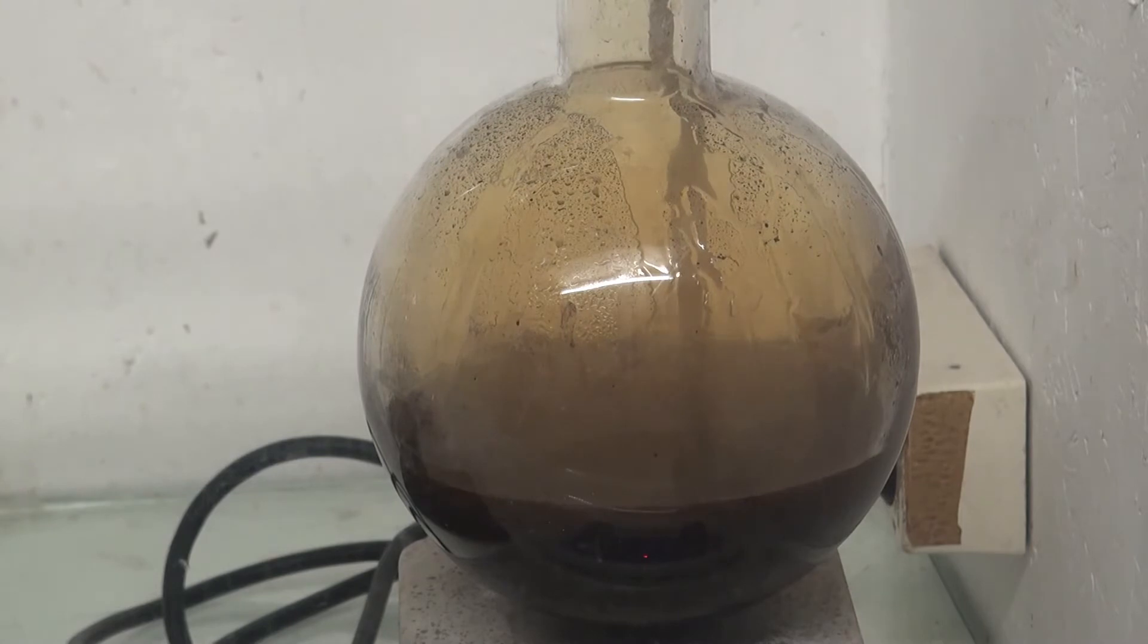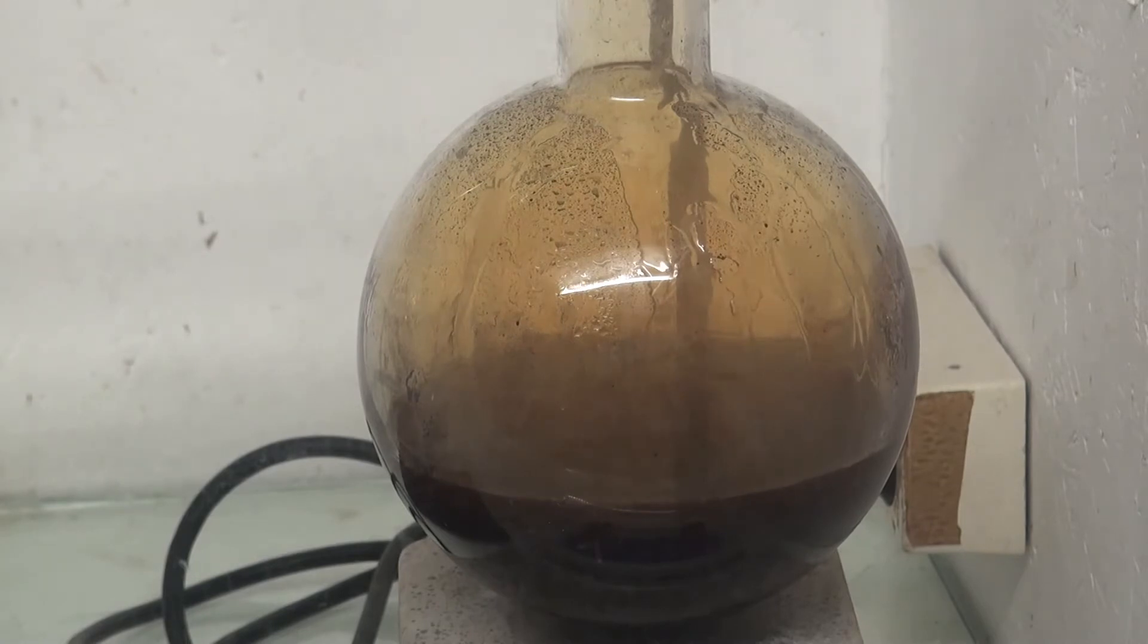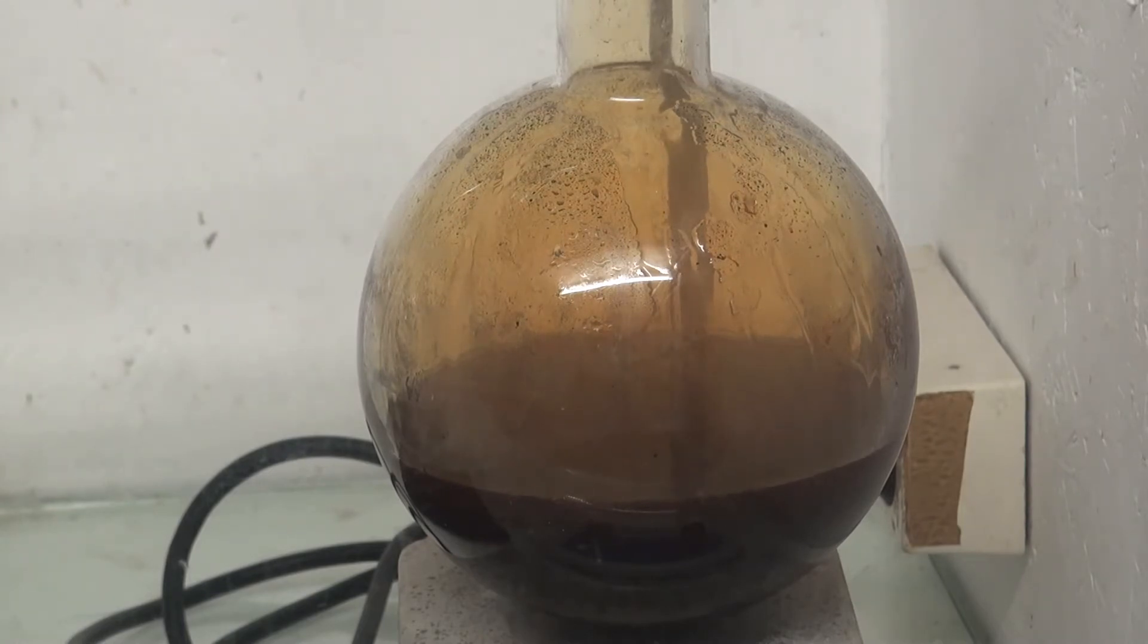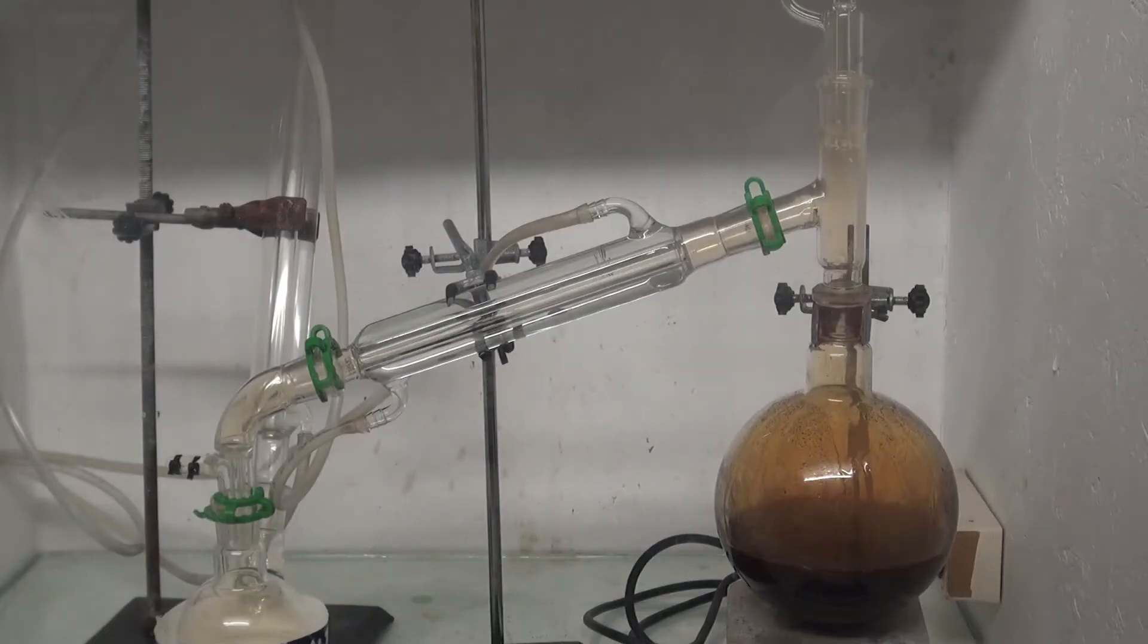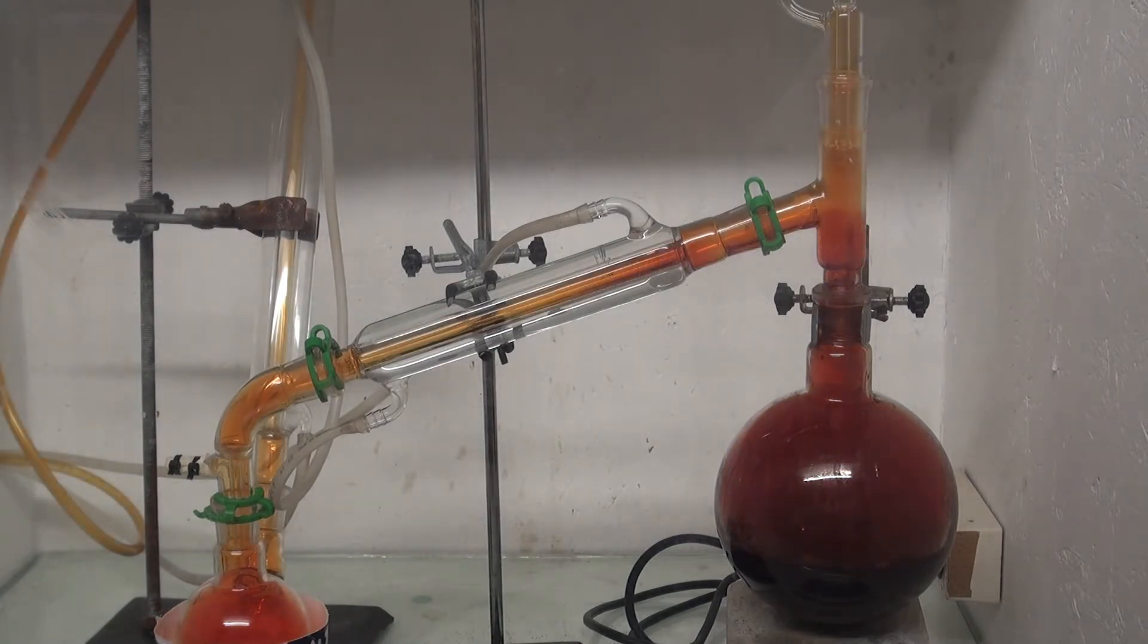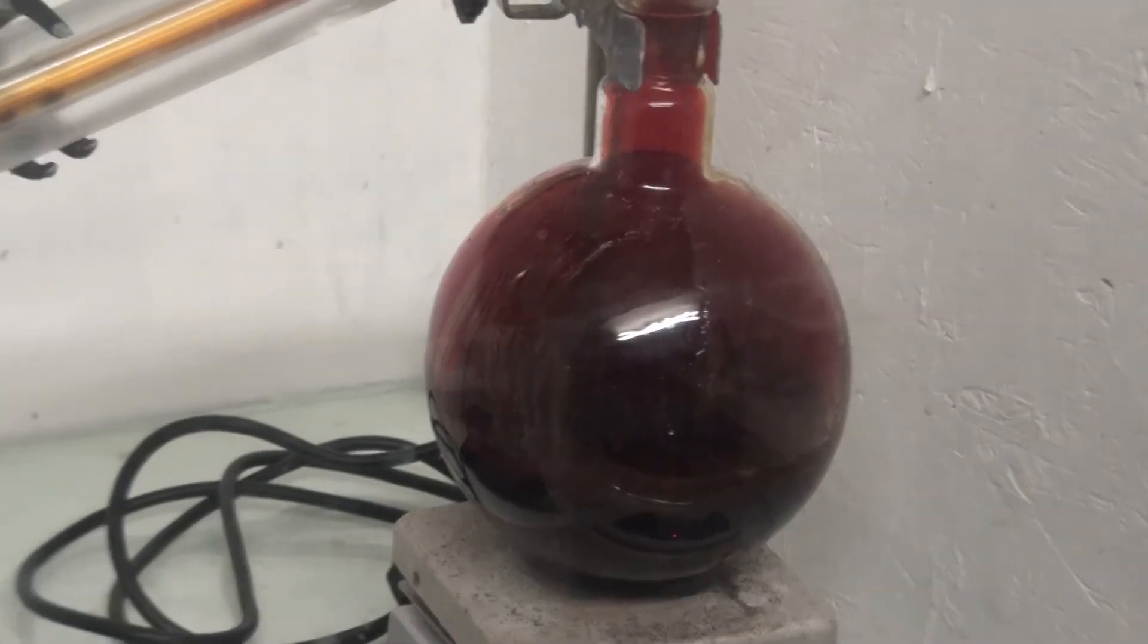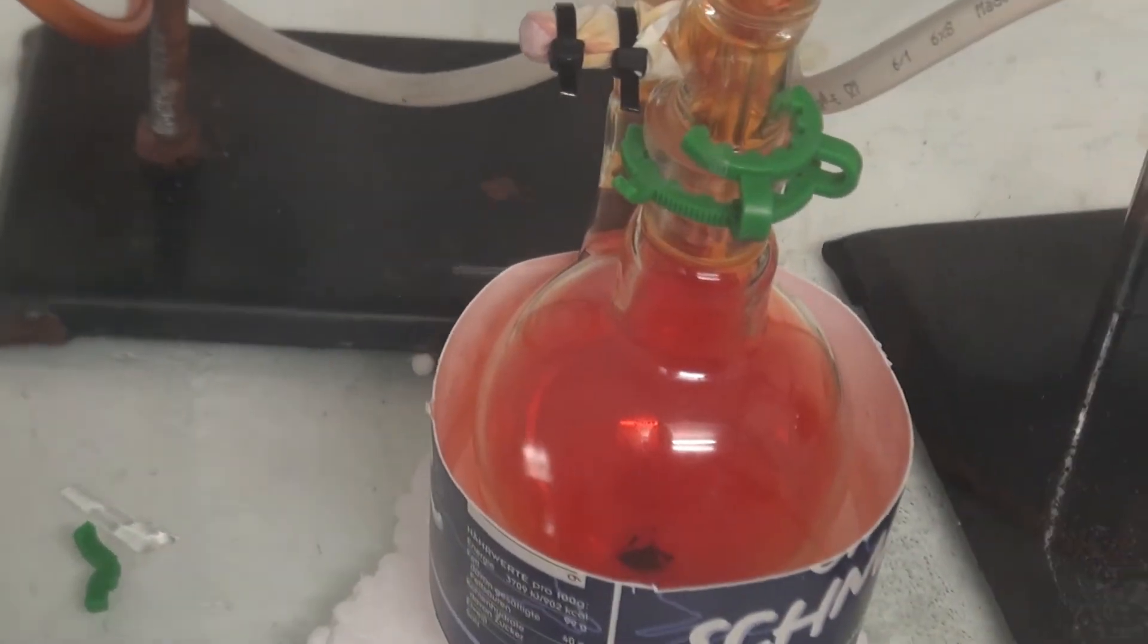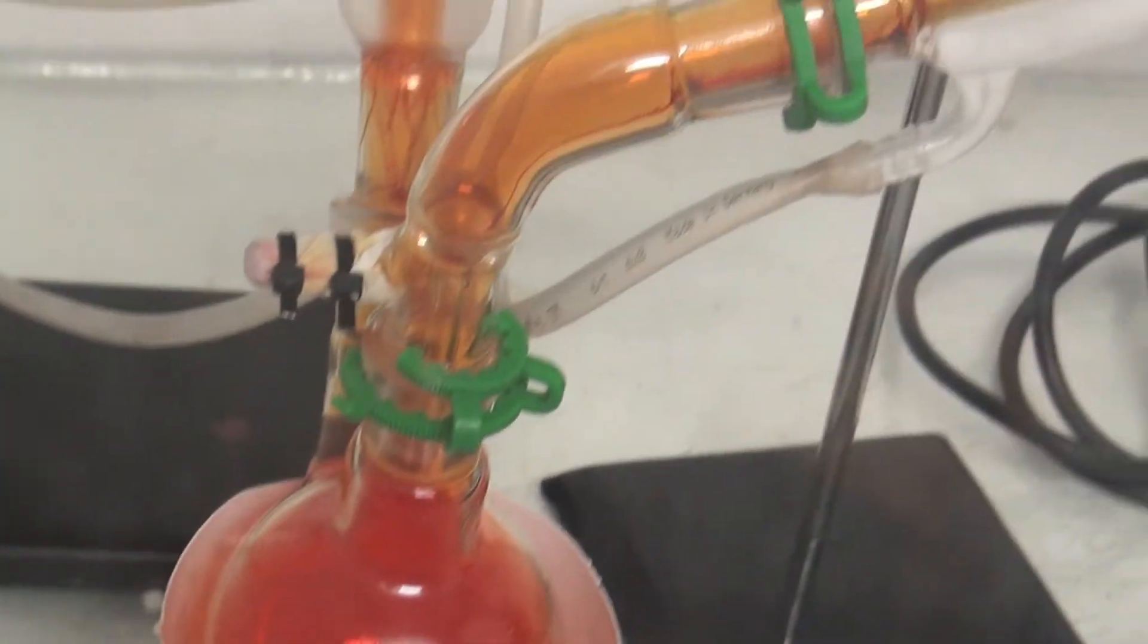After 30 minutes, bromine vapors appeared. 30 minutes later, small droplets of bromine distilled over.